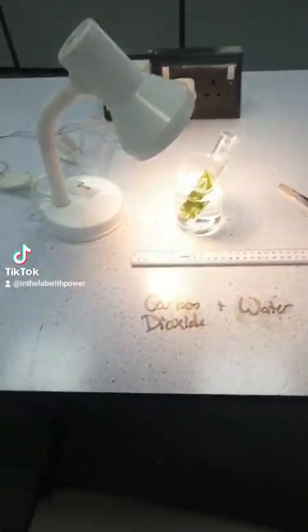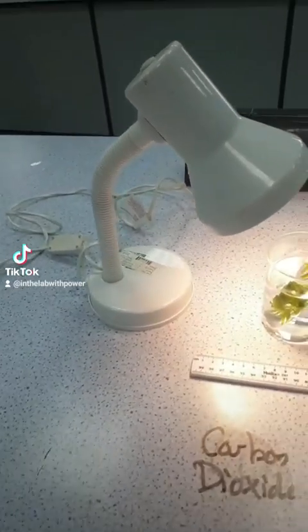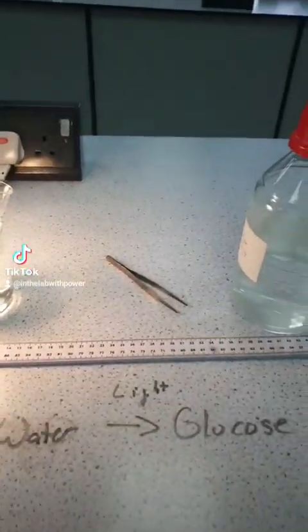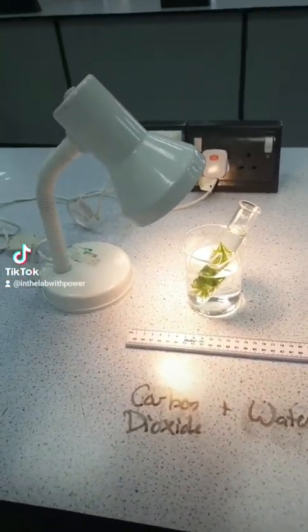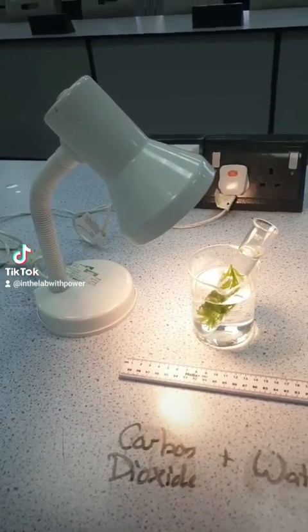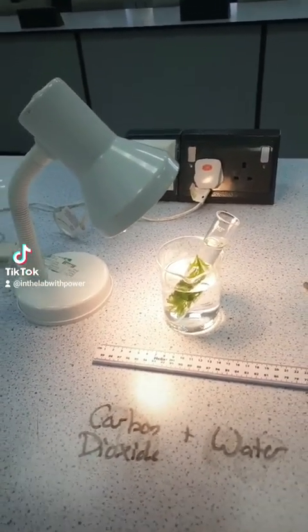Now, the setup of this practical is quite simple. We're going to use light intensity, so we're going to use a source of light, which is a lamp. We're going to be looking at Elodea, and then we have our meter stick. And what we're going to be doing is checking the effect of different light intensities on the rate of photosynthesis.